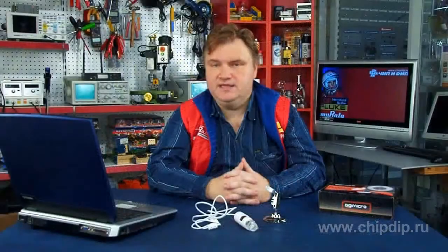The microscope is excellent equipment for educational and professional purposes, as it has a lightweight, compact size, and intuitive measuring software, and therefore is very easy to use.